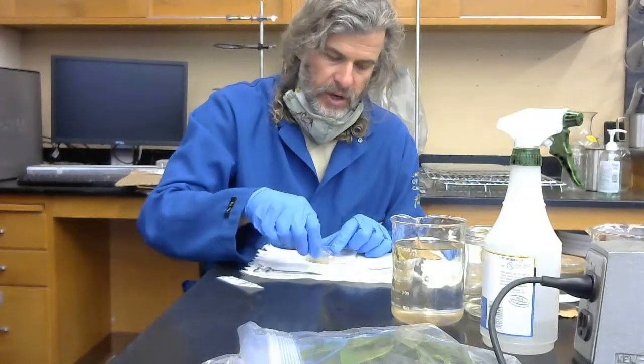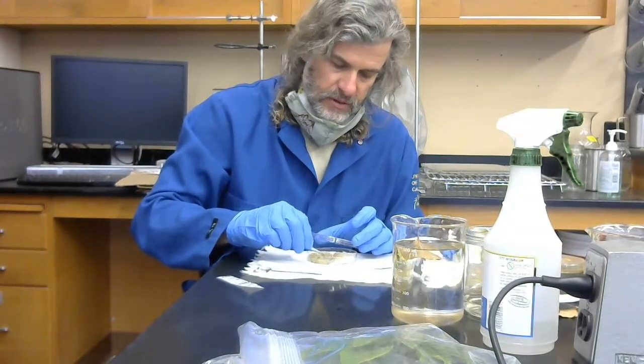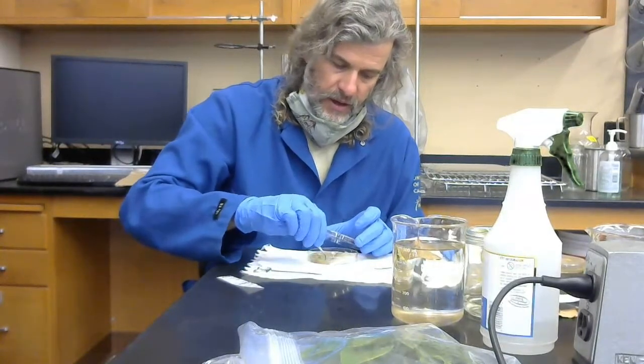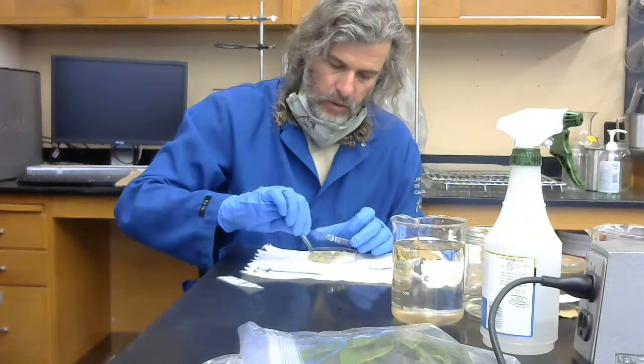But really what you end up with is a set of bits, and I should also mention, use all the space in the plate. That way it will help you once things start to grow out. It will be easier to distinguish what you're looking at.